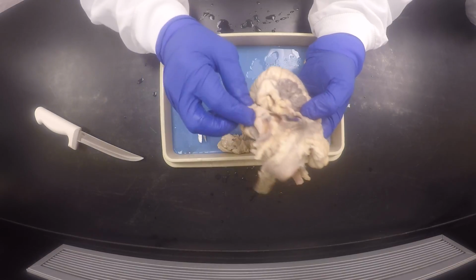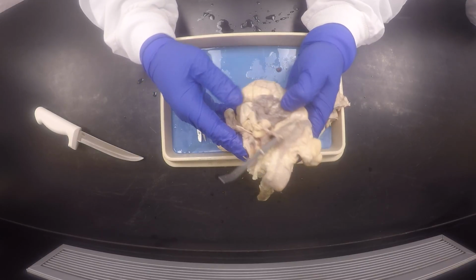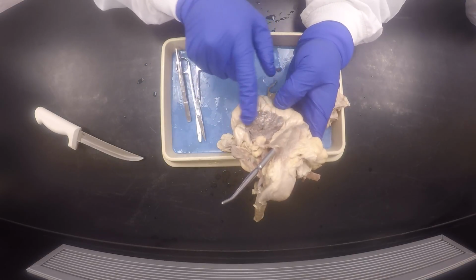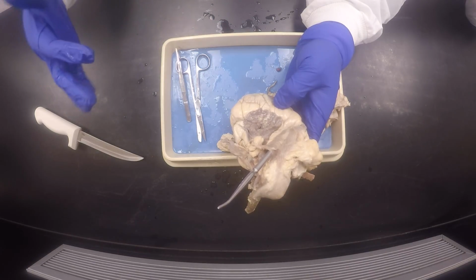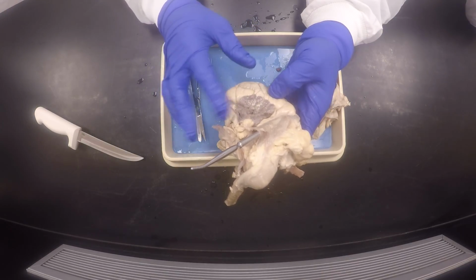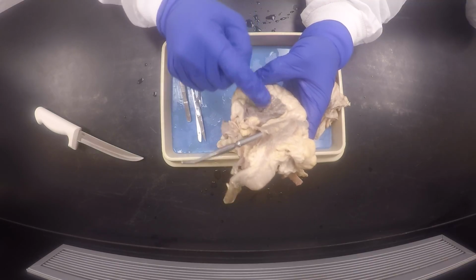Okay, so this right here will be the right auricle. You see this? The auricle is kind of like an extension of the atrium. The atria are very small chambers of the heart, so they have this extension. When the atria are filling up, this balloons up like a balloon, and it almost looks like a beret. You know that little hat that Prince sang about, little red beret. So that fills up.